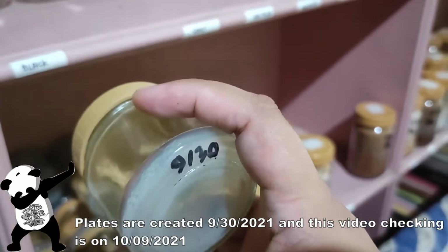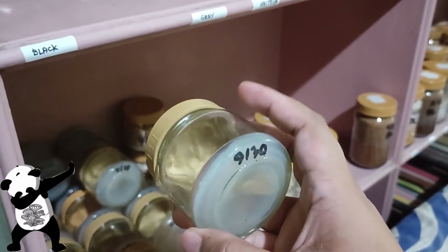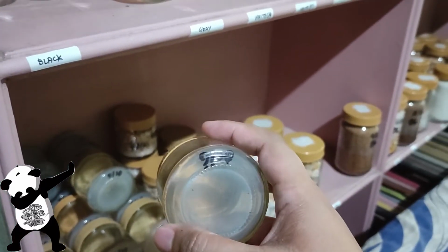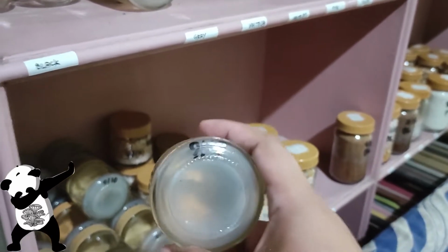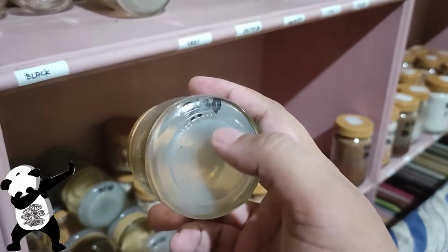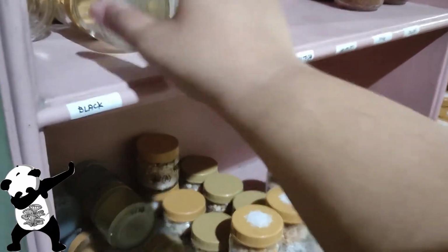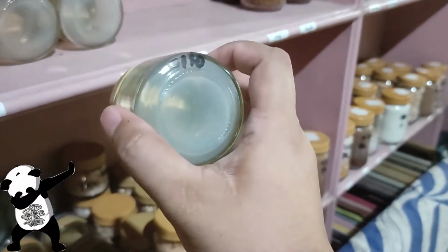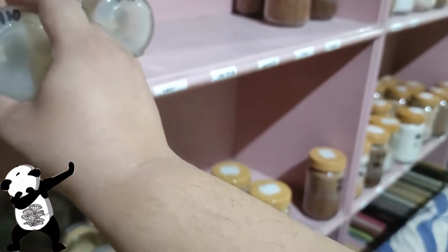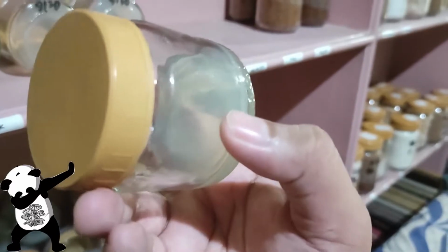So these are the first plates that I've created after cleaning the jars and lids with vinegar. So let's just check one by one, because the past plates that I've created after 9 days, I do see some specks of possible mycelium or molds or bacteria that's actually forming. So we did have the vinegar process added on our procedure, and seeing it right now, I actually checked it yesterday and it's really quite good. The results are amazing. They're all clean.